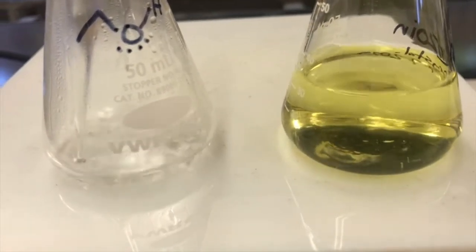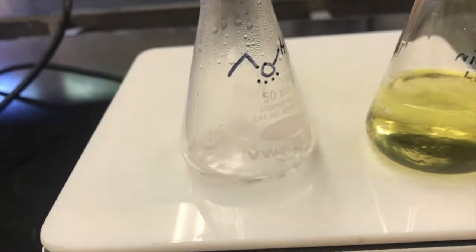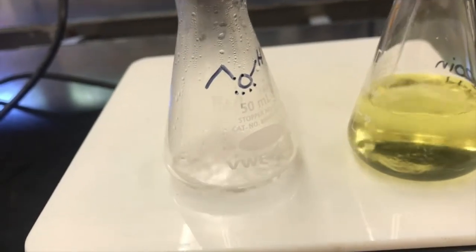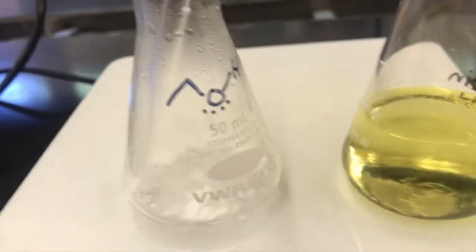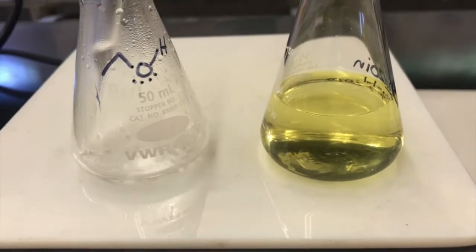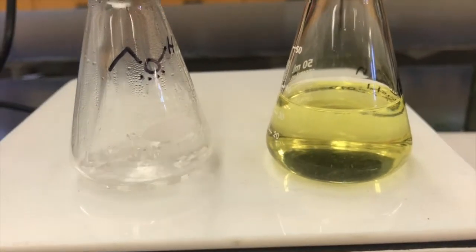Almost there. I'm going to call that the end point. It's close enough for me.